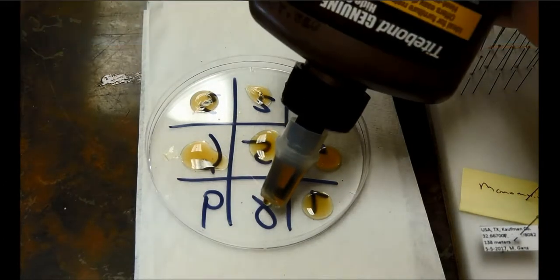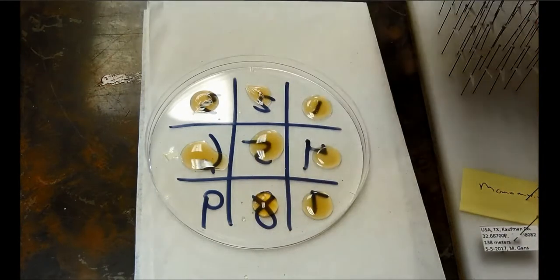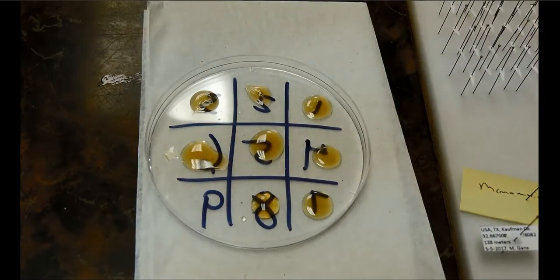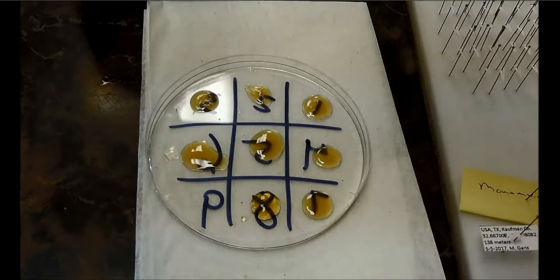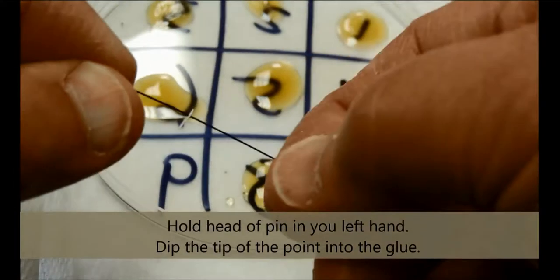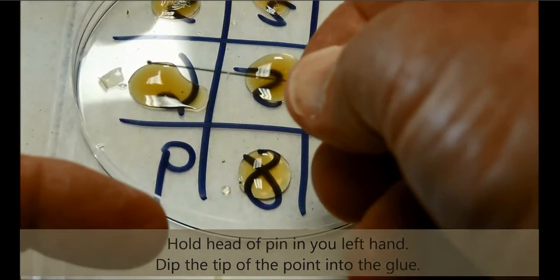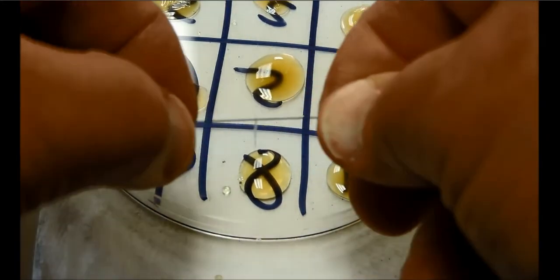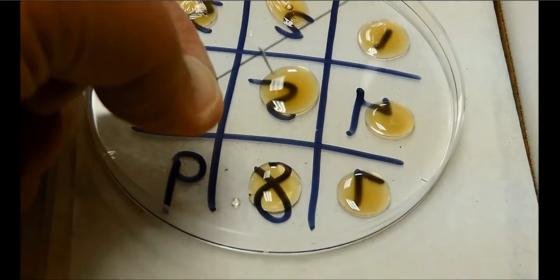Just get a little bit of hide glue — it's water soluble. You need a little blob of glue there. You're going to grab a point and dip it in the glue. If you'll notice, I put the head of the pin to the left, hold that in my left hand, and I dip it in the glue, but I pull it forward so that most of the glue is on the top of the point, not the bottom.